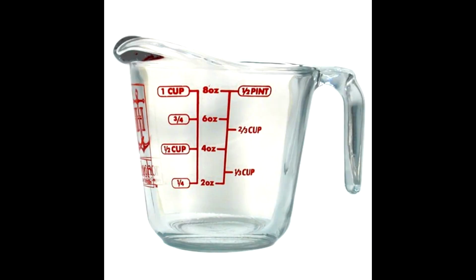It will go to the top of the alcohol because it is not soluble in alcohol. That being said, our question has been answered. Also, if you add too little of these things, the experiment will not work well. It's important to measure things properly, like I tried my best to do, in order to get the expected results.